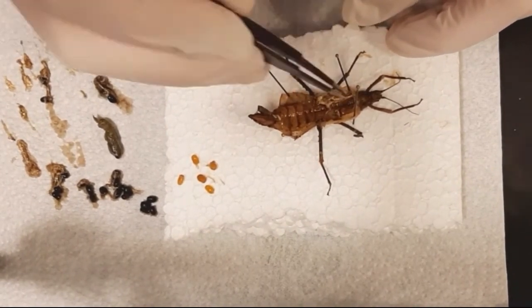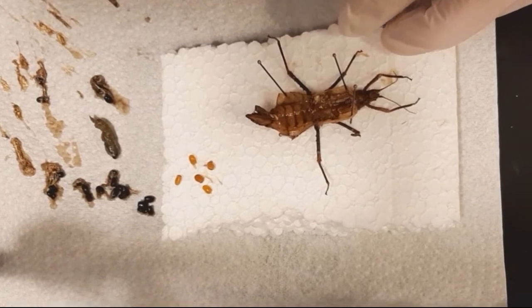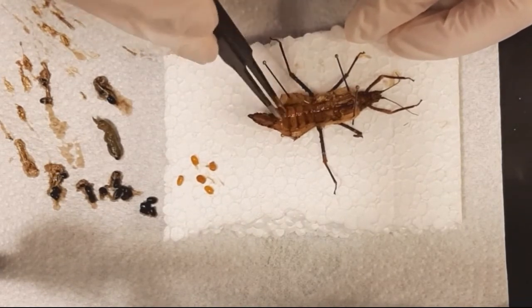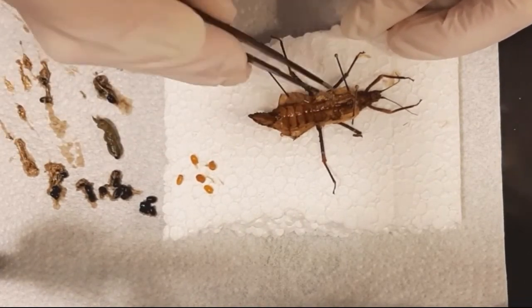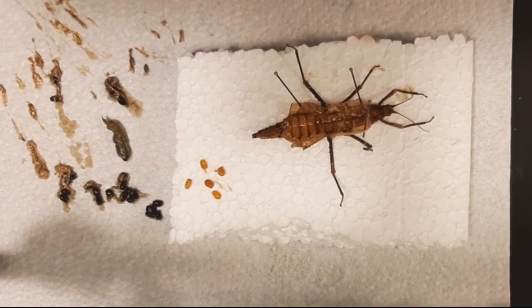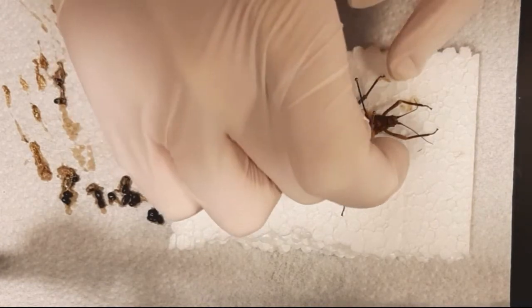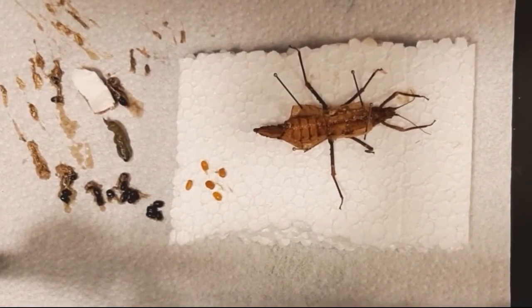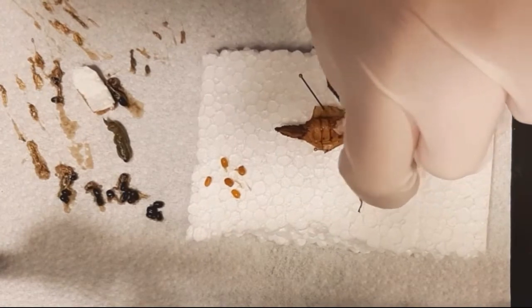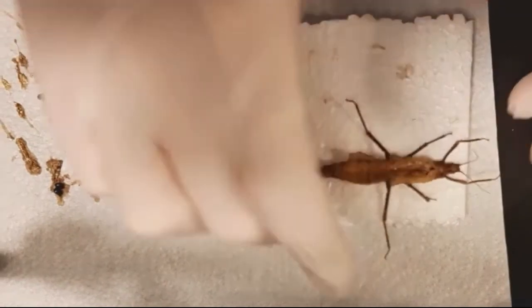The muscle tissue in the legs is hard to remove — try to remove as much as possible but don't damage your specimen. When you cut the specimen, try to cut at the most shallow possible angle because if you cut deep you will cut the organs and make a big mess. The underdeveloped yellow eggs can be preserved in ethanol for display in a museum, for education, for schools, or people with interest — they can even still be studied under a microscope. You can also keep them in epoxy resin, which children can hold and you can bring to schools.